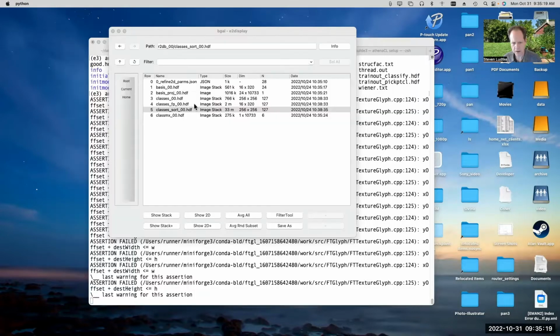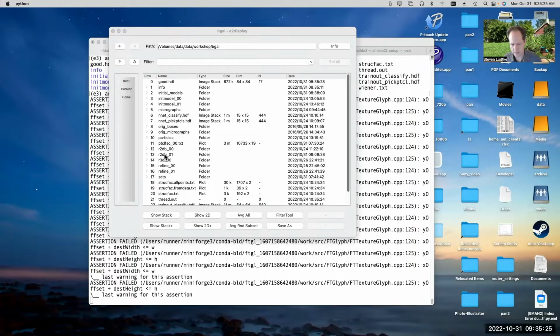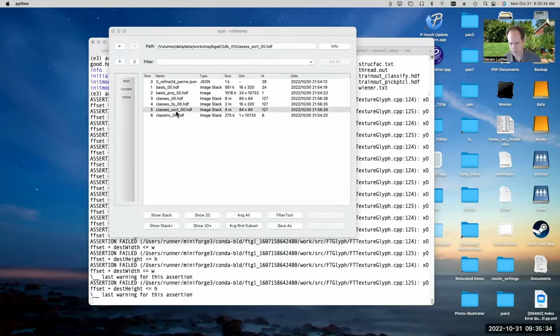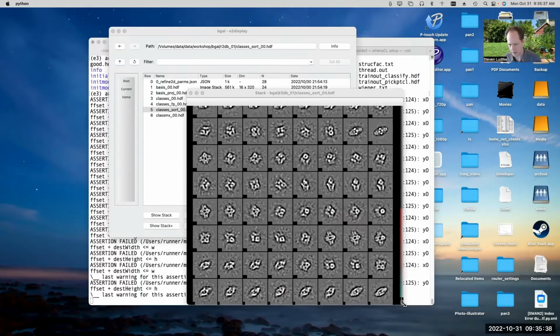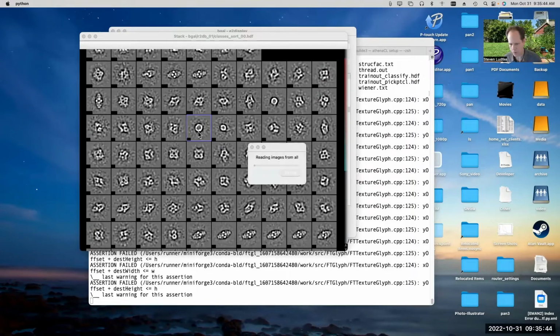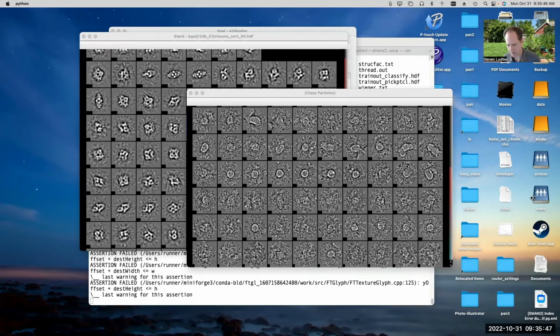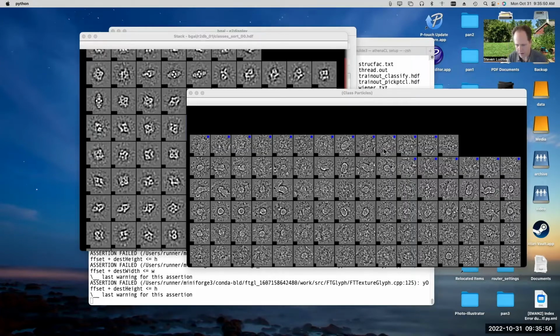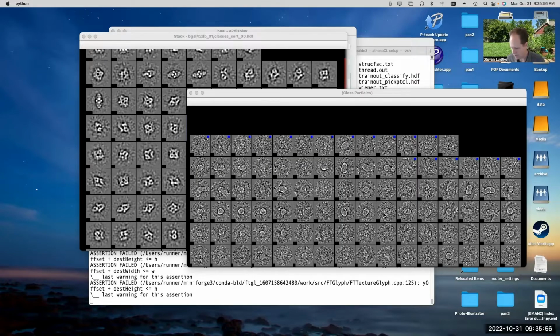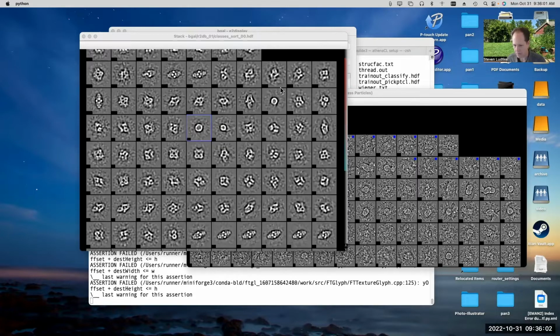So I reran the class averaging process, the reference-free class averaging process, using the downsampled particles, so one of the LP data sets. And if we look at those, you can see they're smaller, and they look similar in terms of contrast and that sort of thing. But if we double click on one of these, we can see a little bit more detail in the individual particles. And what you'll see is that a couple of these classes, like this, seem to have a lot of obvious ice contamination and stuff like that in them. Now, it's not a tremendous number of particles here, but they're definitely present.